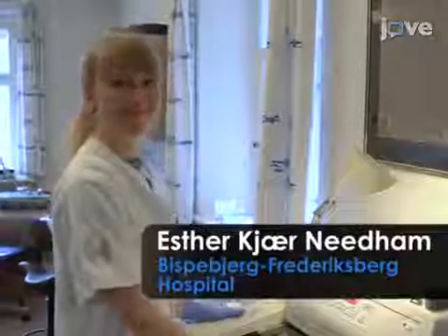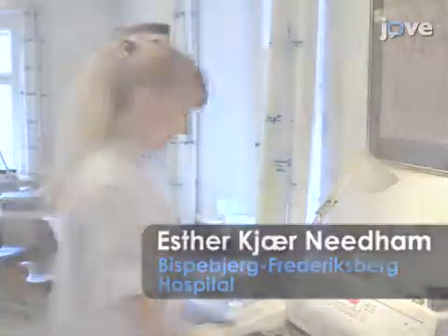This method can help answer key questions in the field of quantitative analysis, such as estimation of the total number of cells in a complete structure of interest. One main benefit of this technique is that it provides accurate estimates with a fixed and predetermined precision. Demonstrating this procedure is Esther Kjær Needham, who is a co-author of the article.